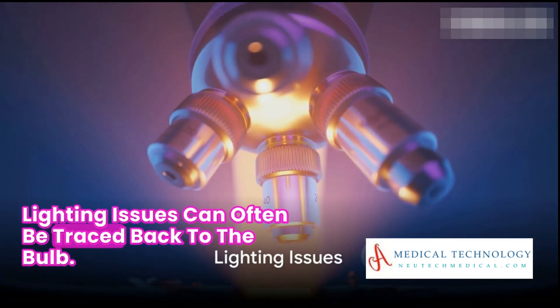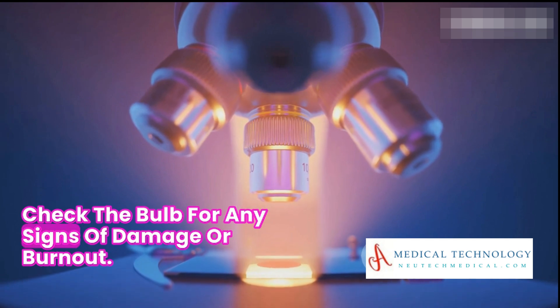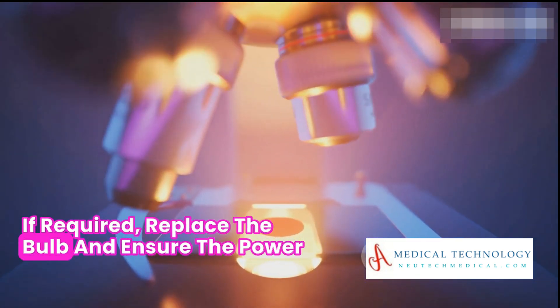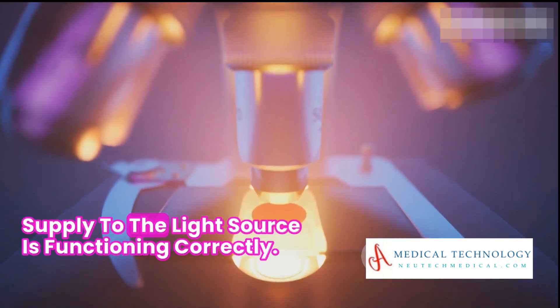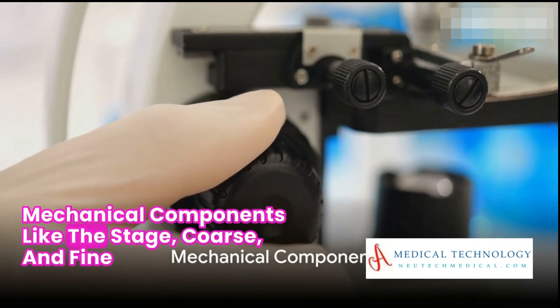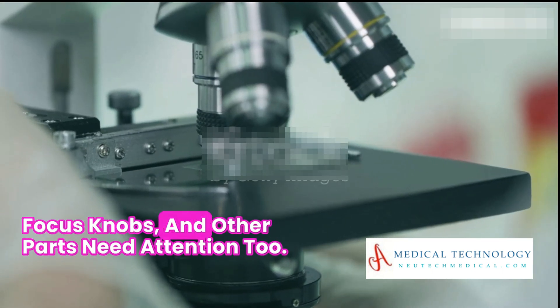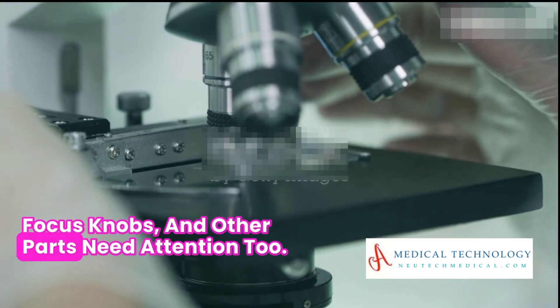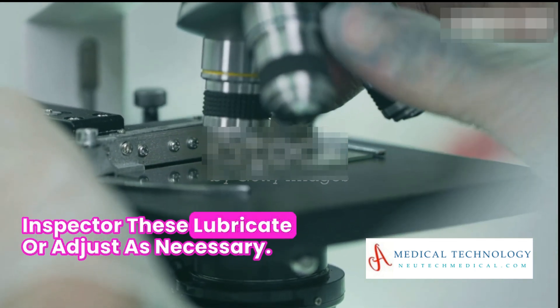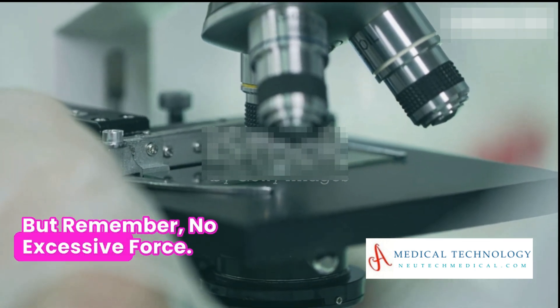Lighting issues can often be traced back to the bulb. Check the bulb for any signs of damage or burnout. If required, replace the bulb and ensure the power supply to the light source is functioning correctly. Mechanical components like the stage, coarse and fine focus knobs, and other parts need attention too. Inspect these, lubricate or adjust as necessary, but remember: no excessive force.